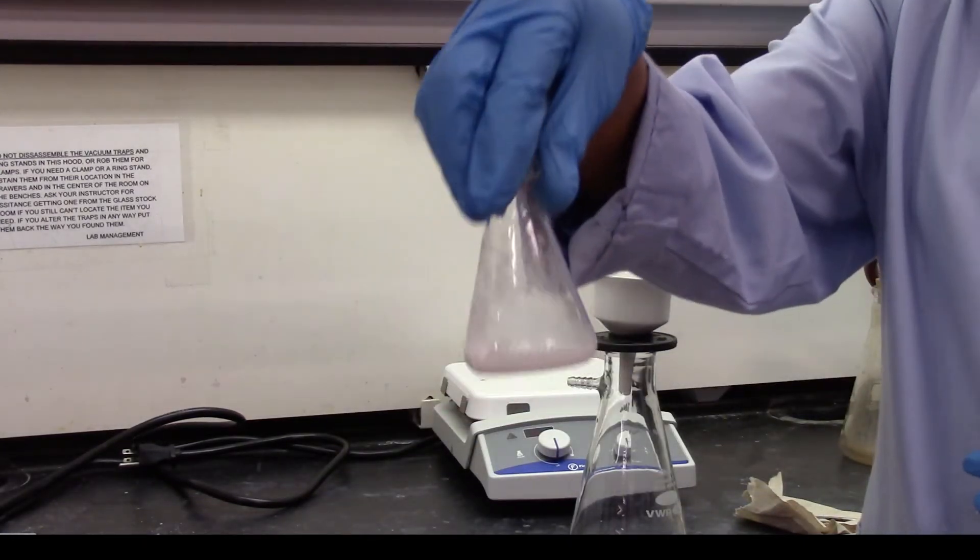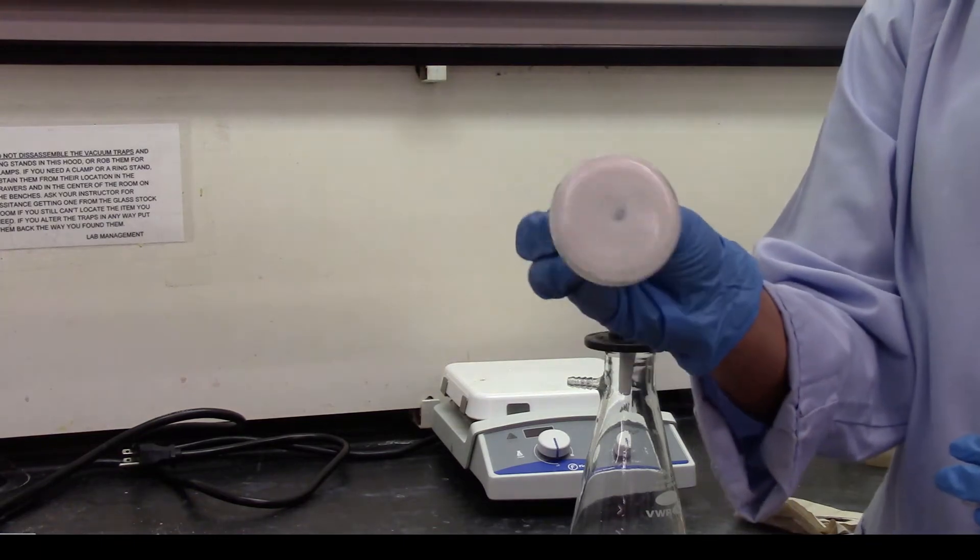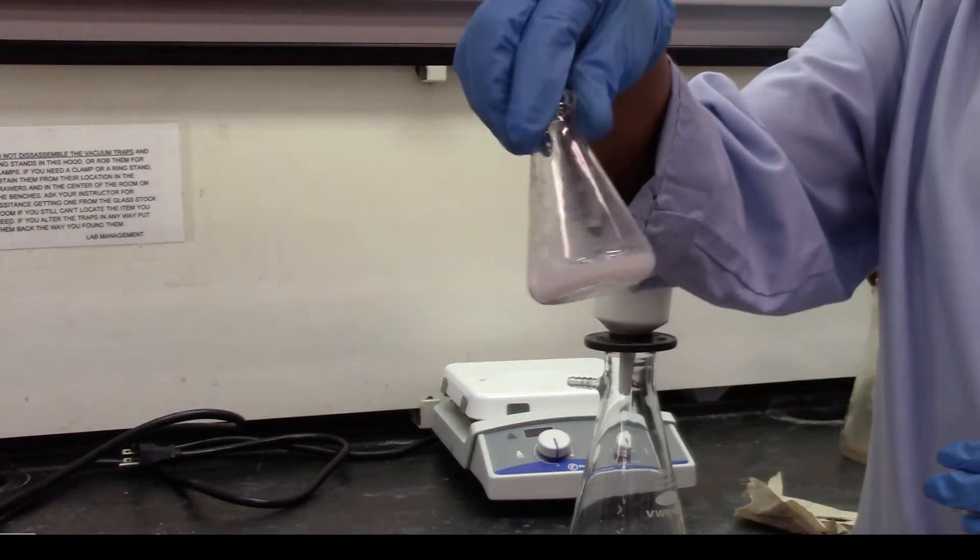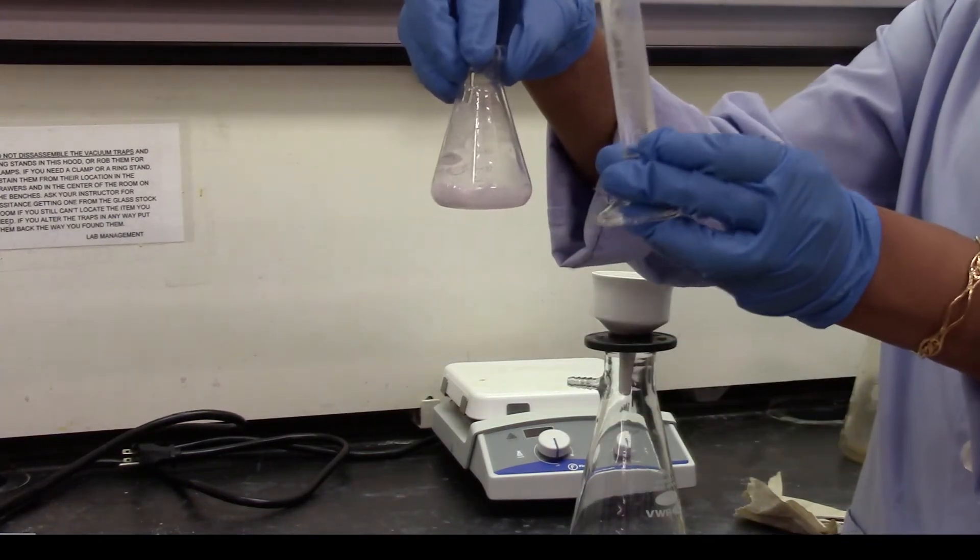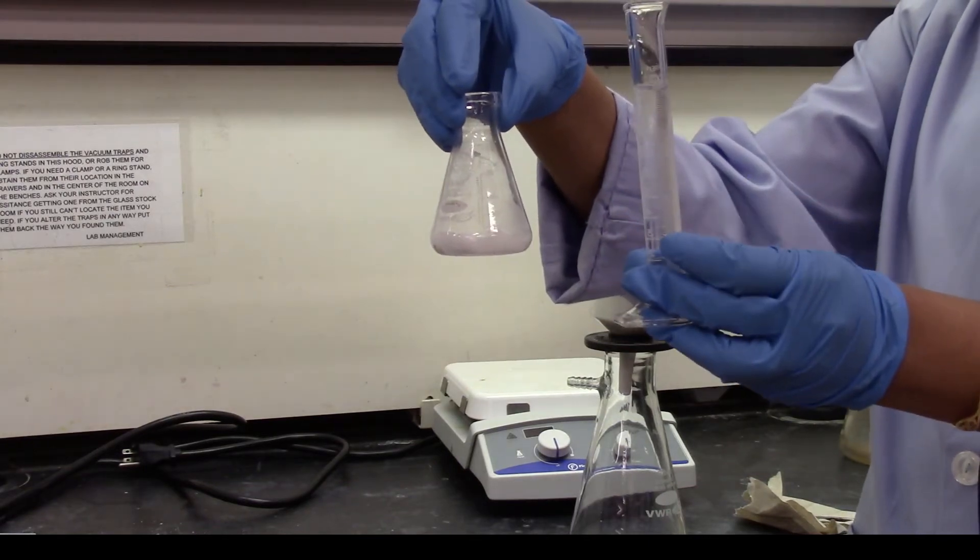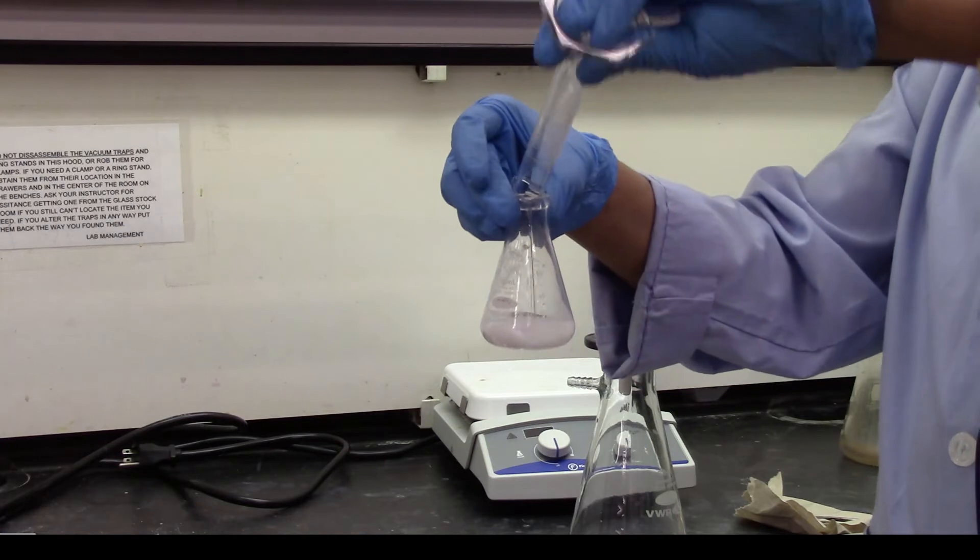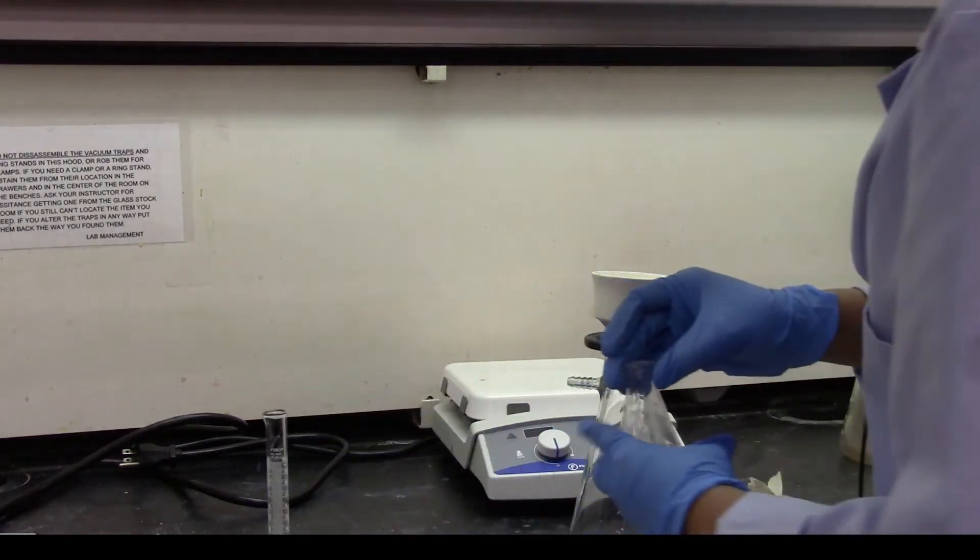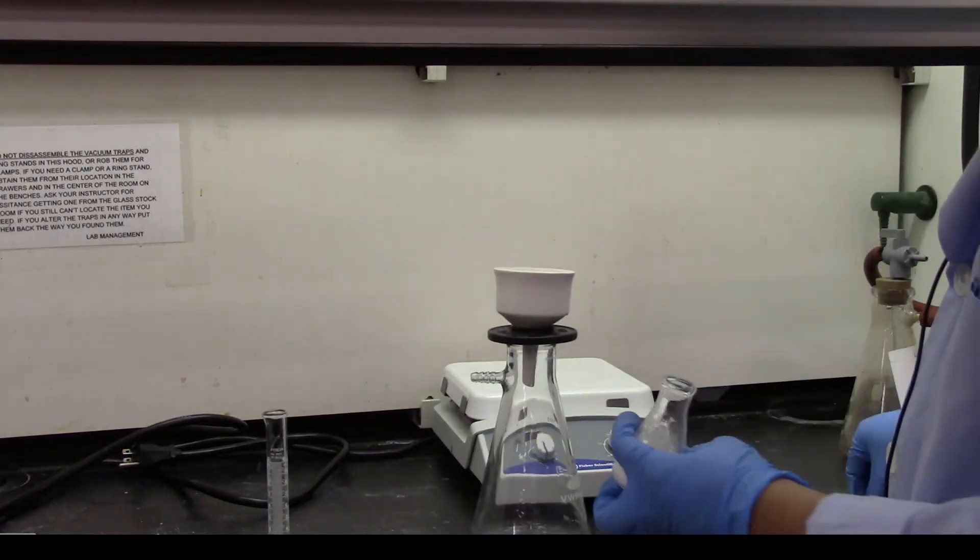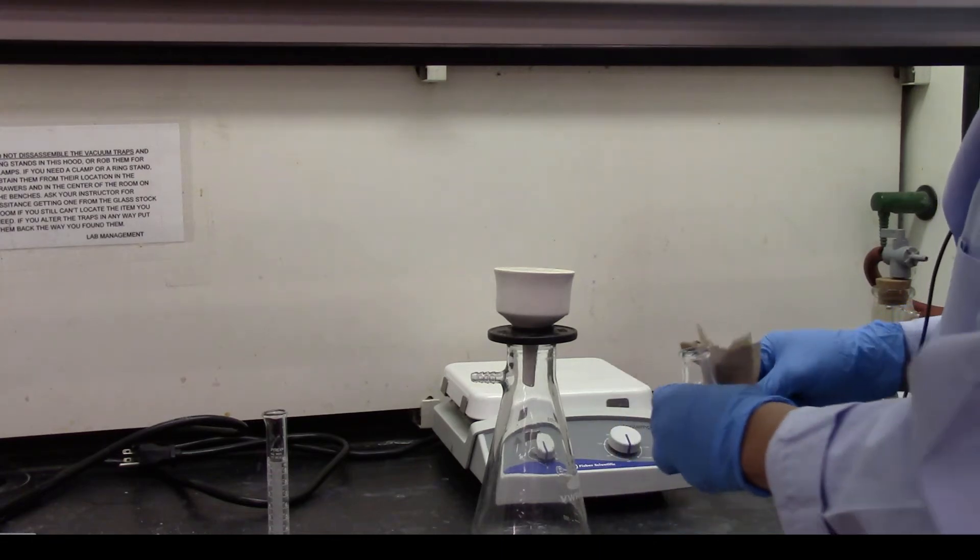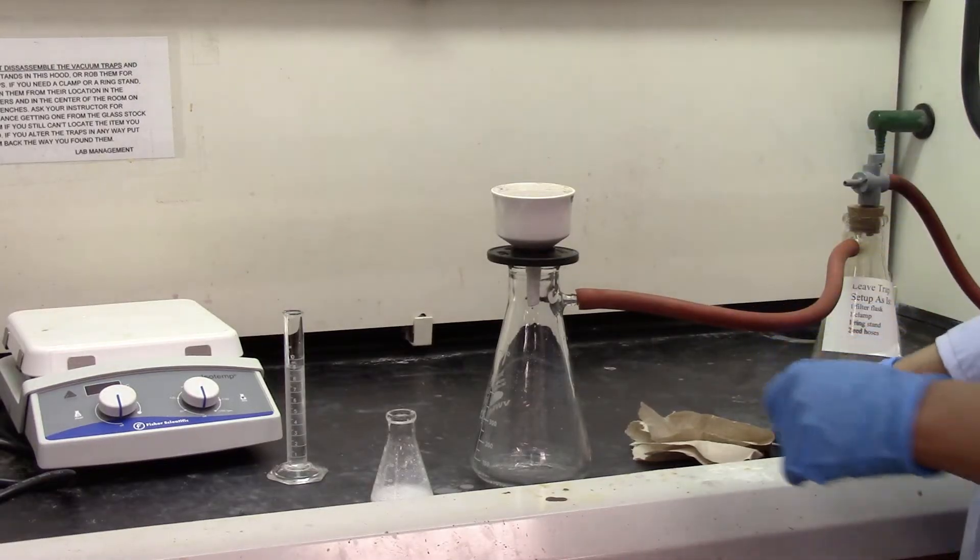So the product has cooled down. Now you can see it's like a sticky mass. It's all sticking to the bottom. I'm going to go ahead and add about 10 ml of cold DI water. And with my filtering setup I'm going to filter out the product. Filtering setup is done.